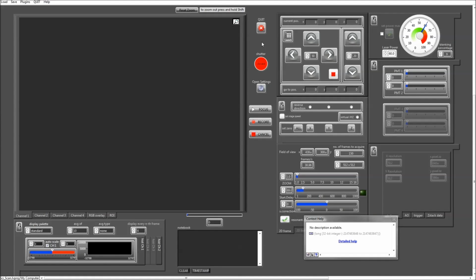So as you can see from this quick demonstration, it's very easy to read values from SciScan and to write values into SciScan. For example, if you need to control the stages from your own custom-written software, or if you want to control the PMT gain, the laser power, zoom values, whatever you see on the front panel, whatever you can manipulate manually as a user, you can also manipulate programmatically from a standalone VI.